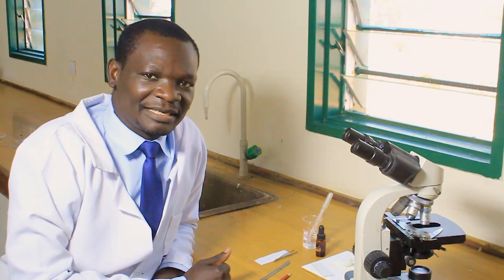To begin with, I want to take you through what you need in terms of materials and apparatus to be able to examine cells under a microscope. These are plant cells, and our specimen today will be from the onion scaly leaf. So let me take you through the materials and apparatus needed to prepare a specimen for observation under a light compound microscope.